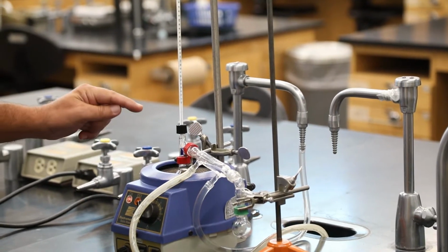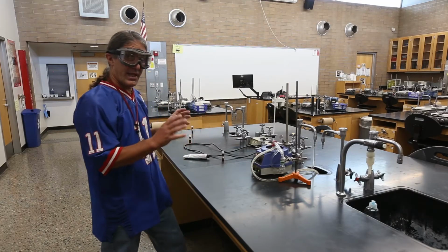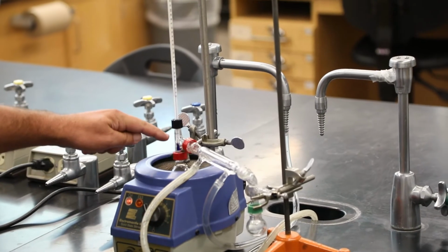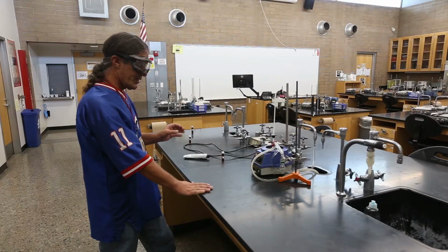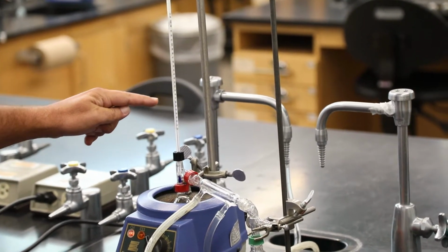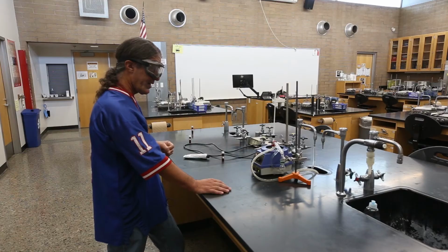If we're distilling one material and it's pure, then as it boils and condenses, it all does it at the same temperature. So that's where we say phase changes happen at a constant temperature. That means as long as this is a pure material, boiling and condensing, it'll stay at that temperature pretty much rock solid throughout the entire distillation. If this temperature starts to go up, there's some higher boiling liquid mixing in there or something else. But if it's a pure material distilling properly, you're going to get one temperature through the whole collection. So we verify that usually.